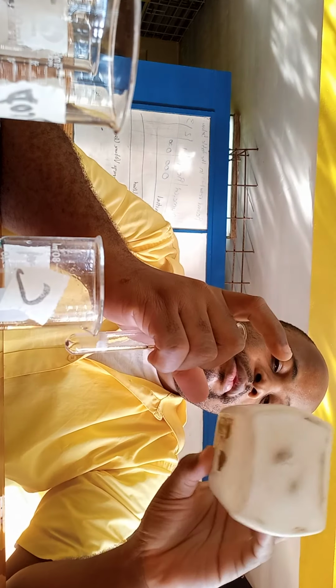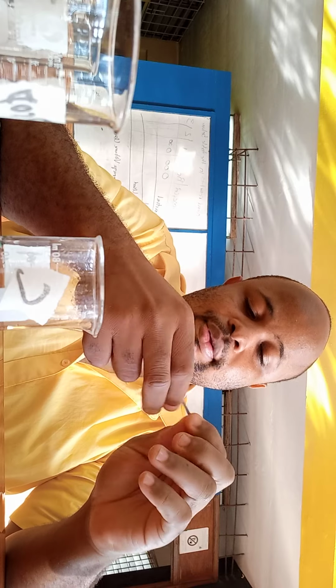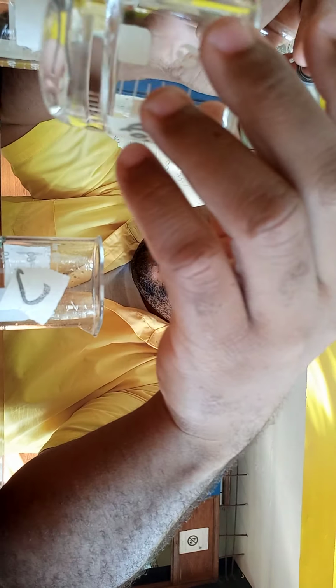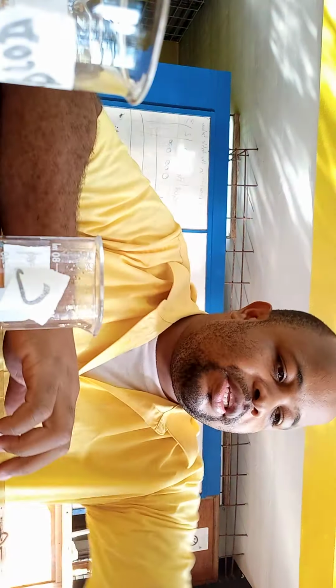But the one that is supposed to be the ketone, it is still reacting as well. So, or probably it hasn't fully gone to the ketone. Let me see something. Give me a second. Where's the magnesium? Alright, as I can see here, I dropped it in the alcohol A. No reaction is taking place.